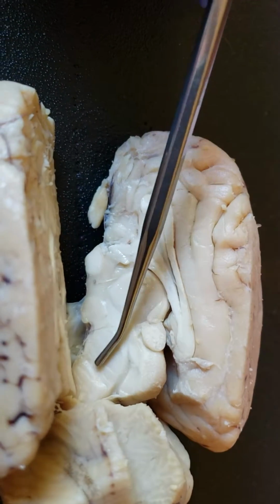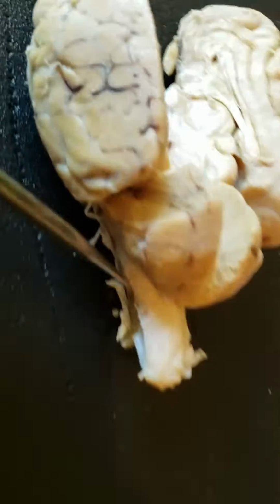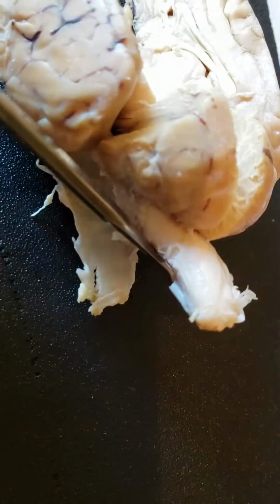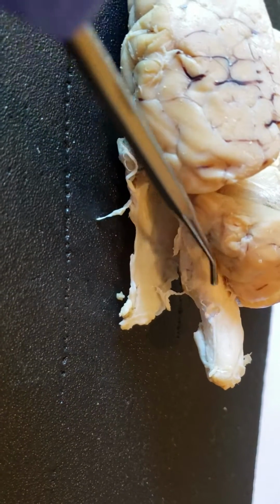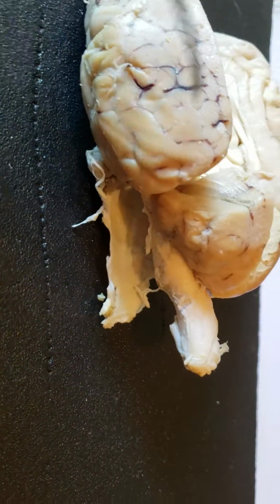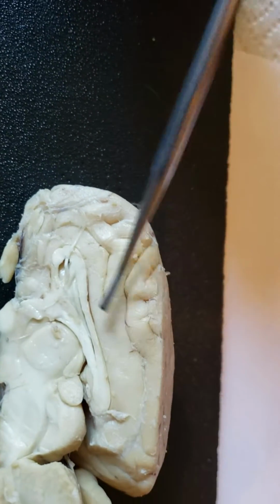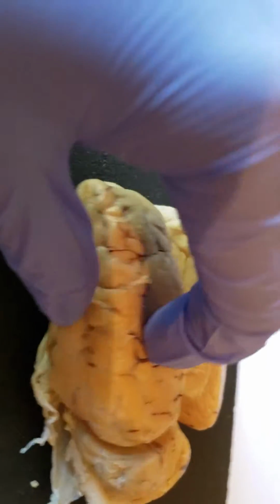Yeah. So now we're going to move into the midbrain. So the midbrain is going to be this thing right around here. The medulla oblongata is this. Peel this back. I did peel back. The medulla oblongata is this part of the brainstem, and the cerebral cortex is the entire outer layer of the brain. So like all this in here is cerebral cortex stuff.